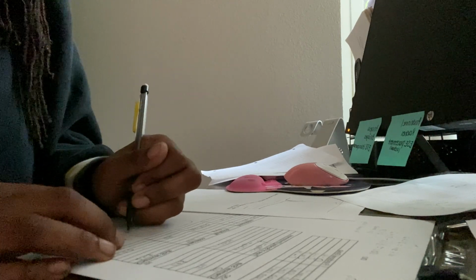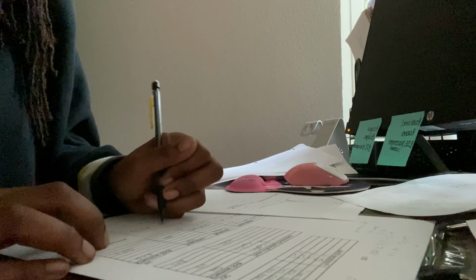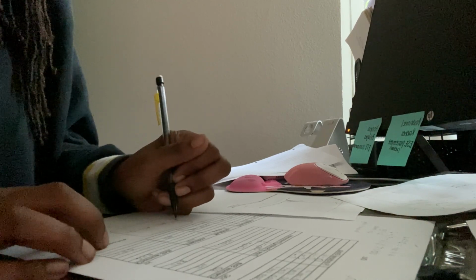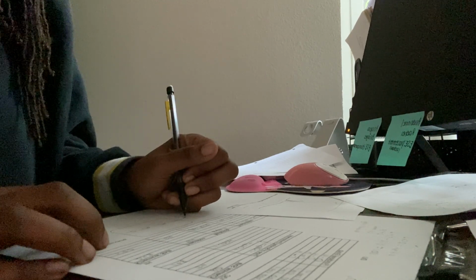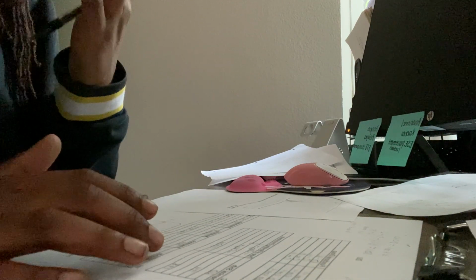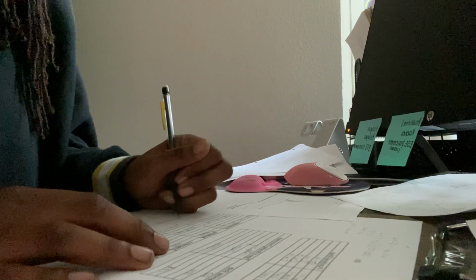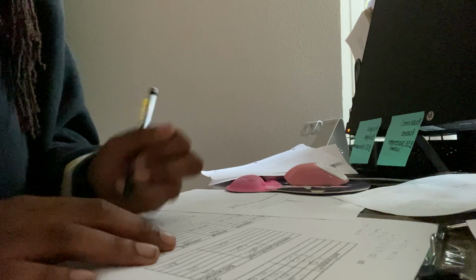So I know that I have to have carbon, 3 methyl groups, another carbon, but I'm missing something because up here I know I have 4 oxygens and 8 hydrogens. And here I only have 6 hydrogens and no oxygens. So how do we fix that? We add an OH on one side and an HO on the other side.